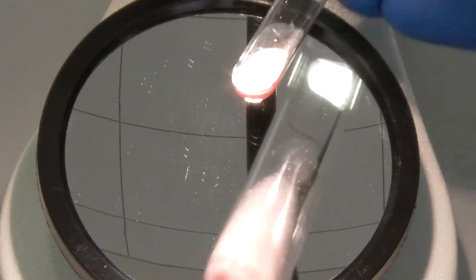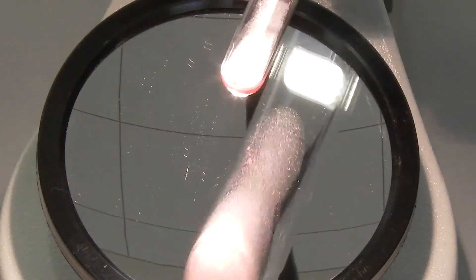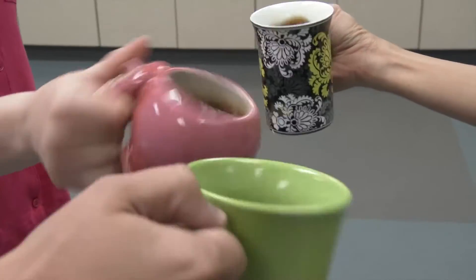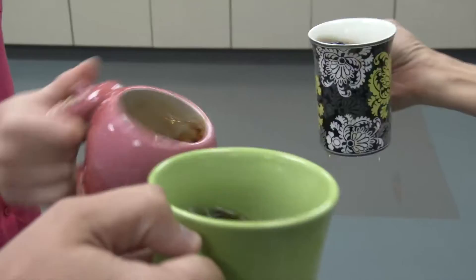In between rocking, shake the tube gently when the button is in the solution. This gentle shaking motion is sometimes referred to as caffeine jitters.